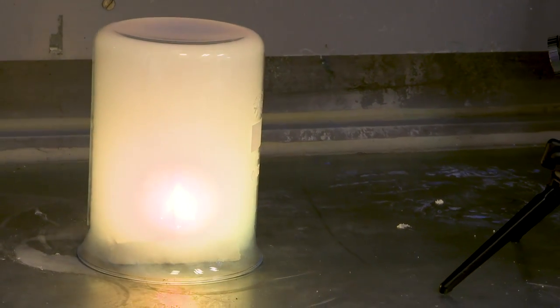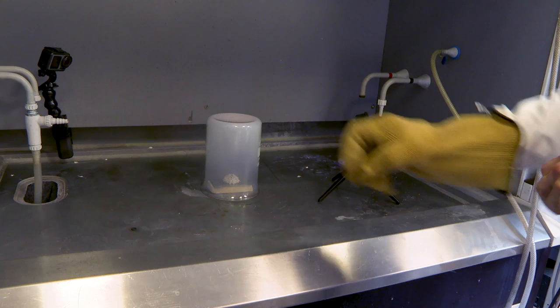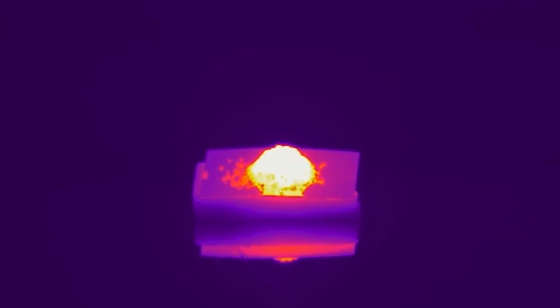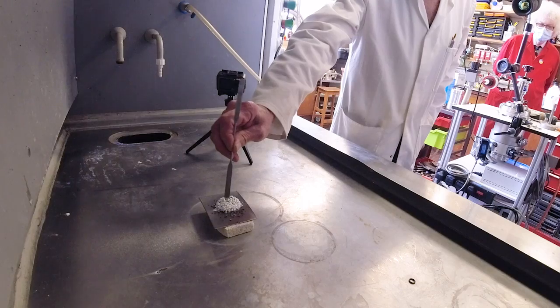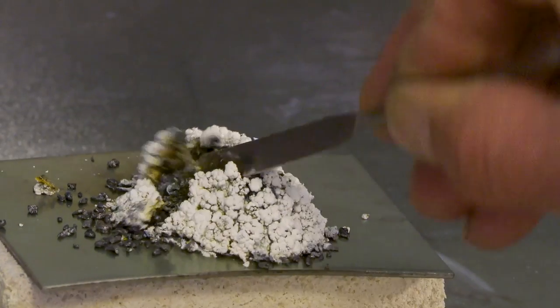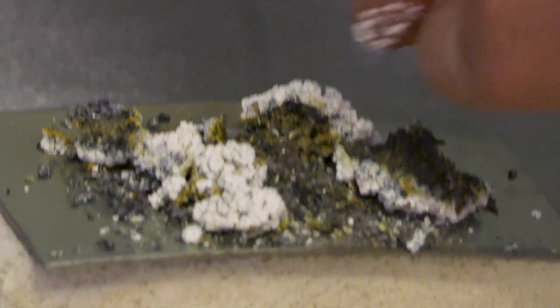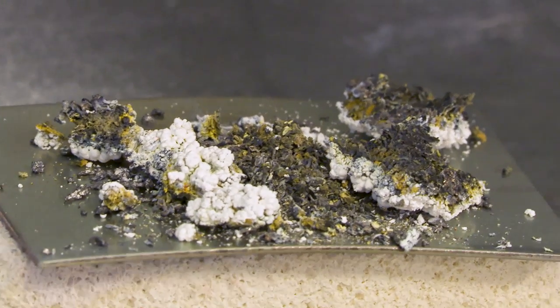I'm not sure what that blue-green colour is. It might be from nitrogen atoms recombining, which give a green colour. The reaction eventually finishes. Neil got a big glove and removed the beaker — it was very hot. The pyramid was white on the outside with magnesium oxide, but when he cut it in half with a spatula, inside there was some black from the unreacted magnesium and a yellow colour, which is magnesium nitride.